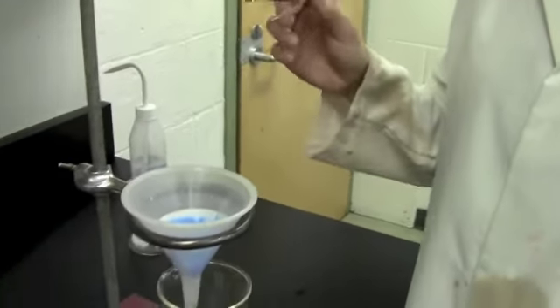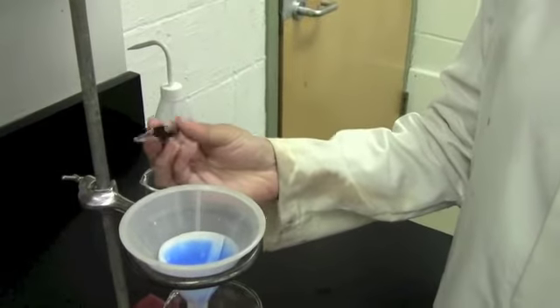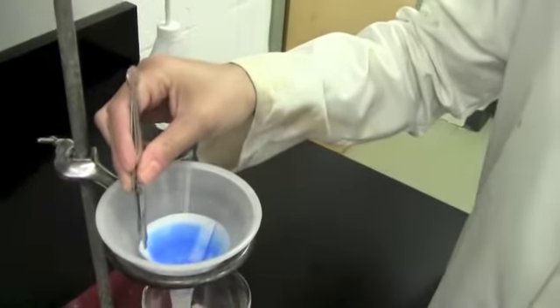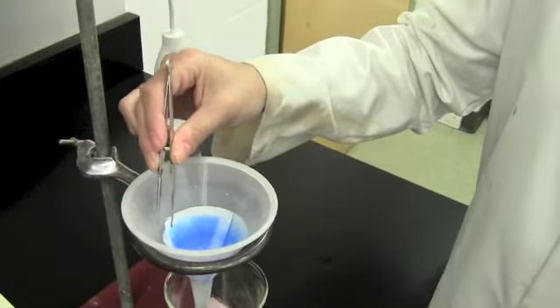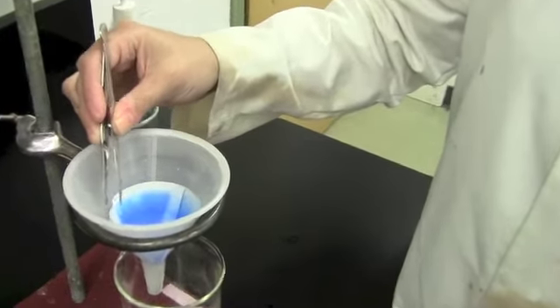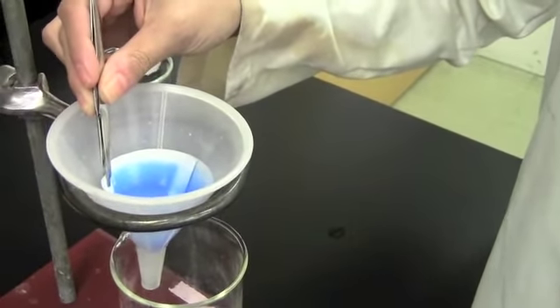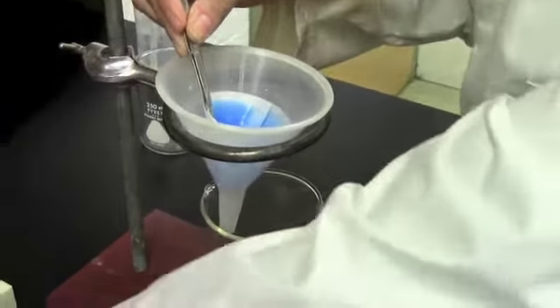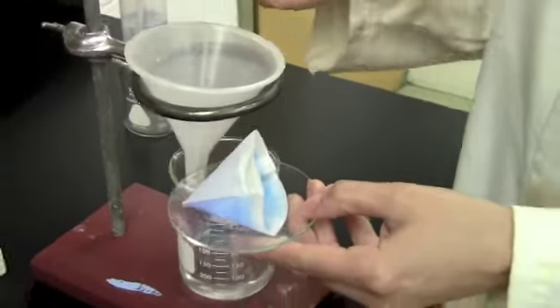Now we want to take the filter paper with the crystals out of the funnel. This part's a little bit tricky. You're going to want to use some tweezers and you're going to very carefully separate the filter paper from the side of the funnel. A couple things to look out for. Don't let the tweezers touch the crystals themselves, because then the crystals will get stuck to the tweezers. And be careful, this is wet paper now, so it rips really easily. Carefully take it out of the funnel and immediately place it on a watch glass.